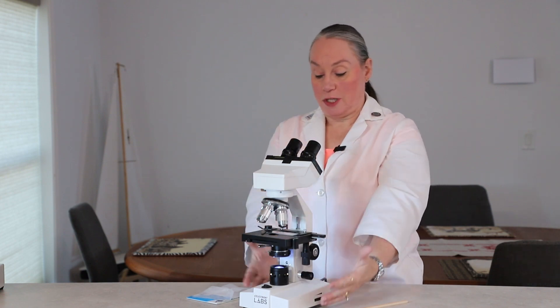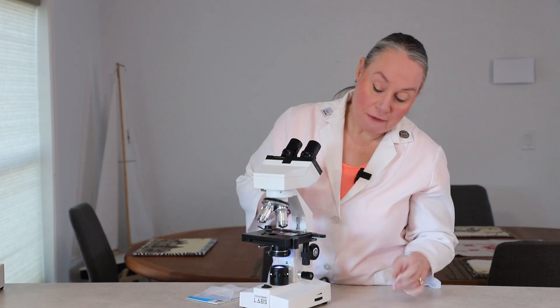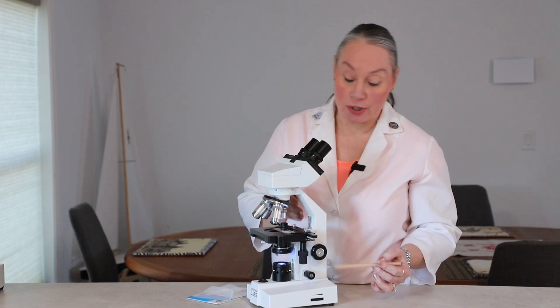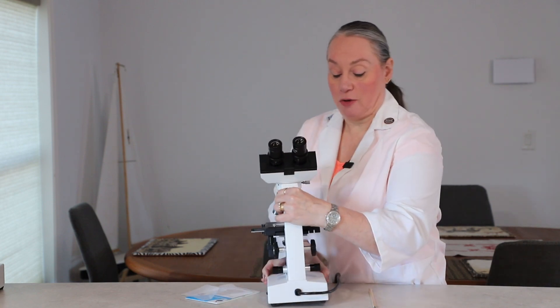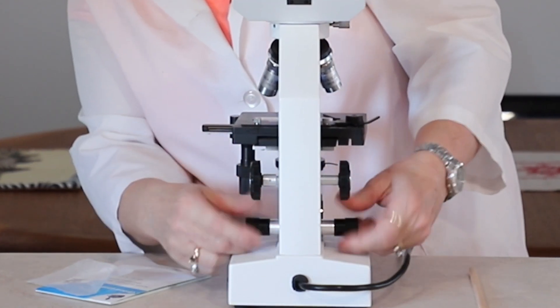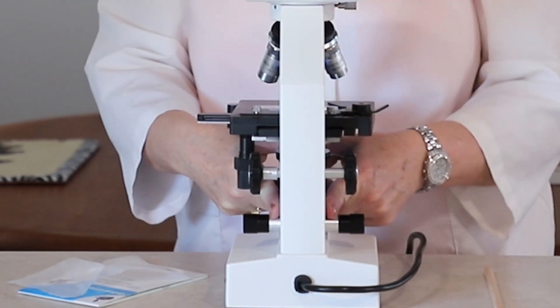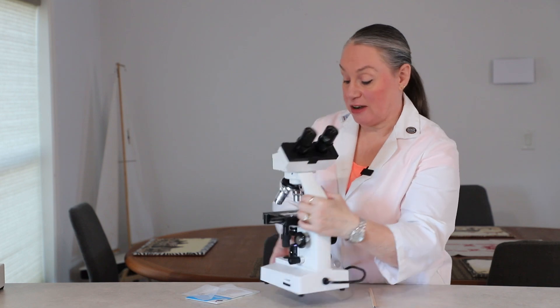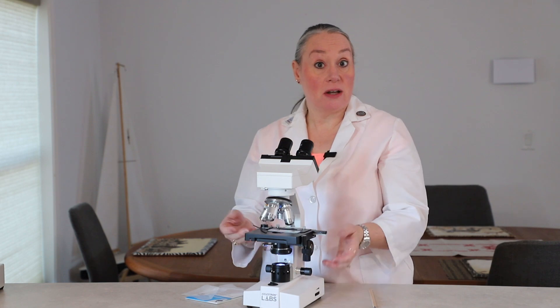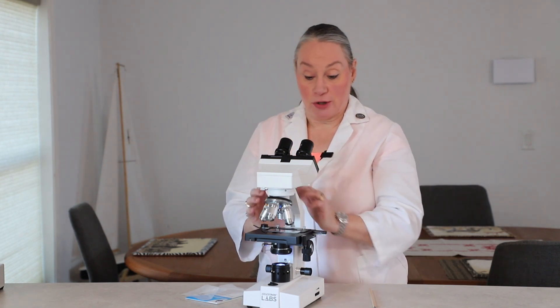So we've got our microscope — it's here, it's turned on, our lenses are clean. Now let's talk about the fine adjustment knob. This is where I have found my students have terrible problems. When they want to go all the way up to high power, they're not able to focus because somebody who used the microscope before them has got this off-center. It needs to be returned to being in the middle — you want to make sure that the metal on both sides is pretty much as even as you can visually see it. That's going to allow you to get a great focus on high power. If it's off-centered and you cannot focus on high power, just start again with low power and go through the process.